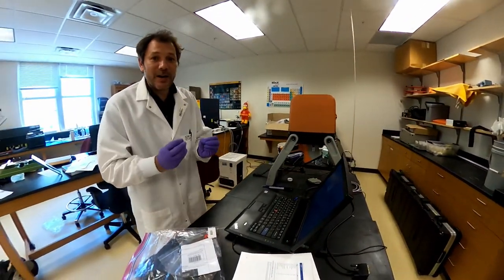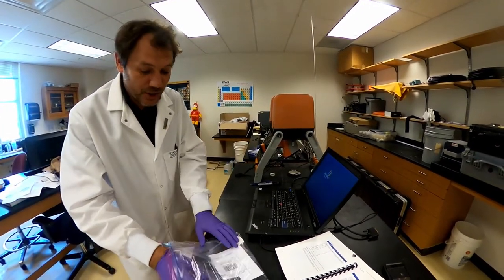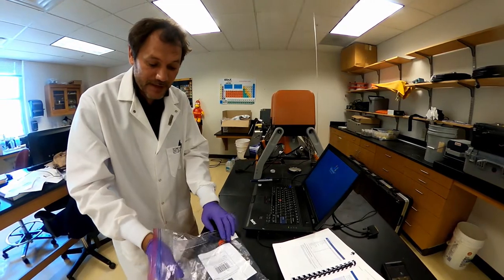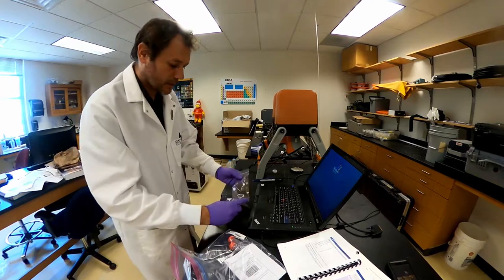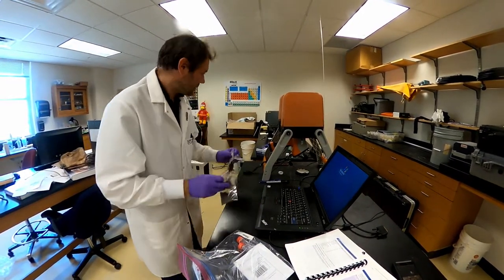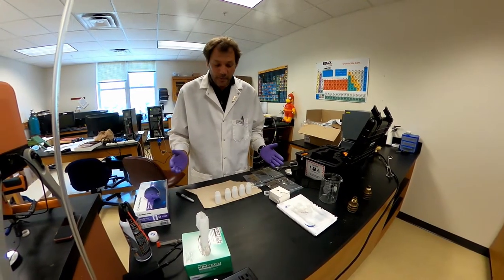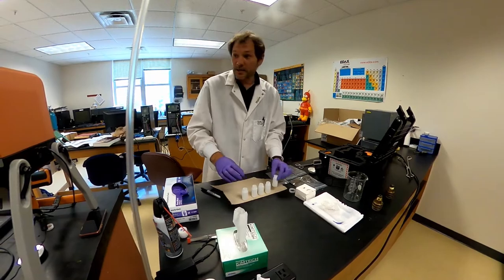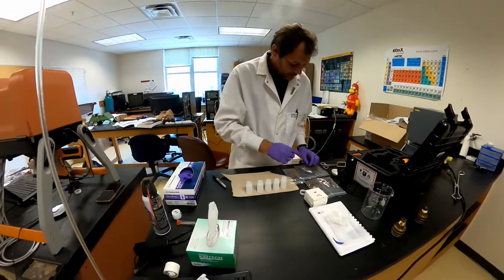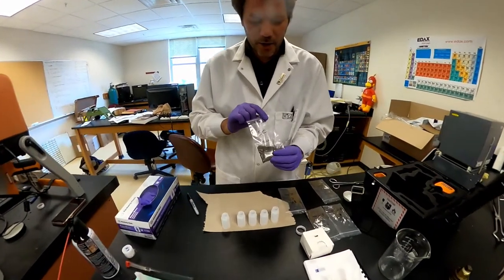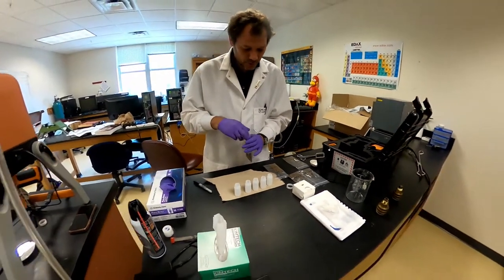So it's actually a very simple analysis, a very short analysis, and I will just start analyzing the five samples that we have. We're going to start with the composite sample, here are my five samples, put them on the prep. So we're going to load the sample so that we can use these vials and analyze for lead content and concentration. I'm going to prepare the composite sample for the house that corresponds to the video two days ago, three days ago.